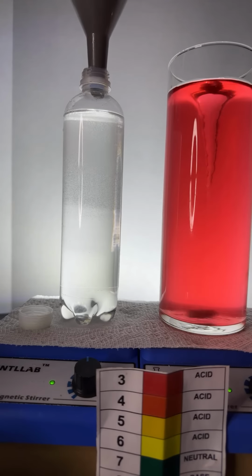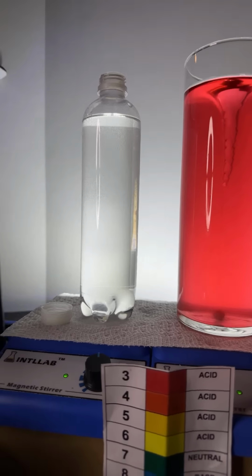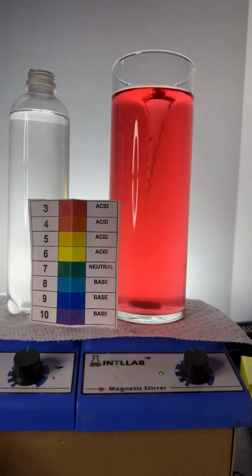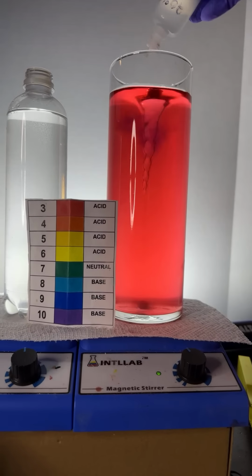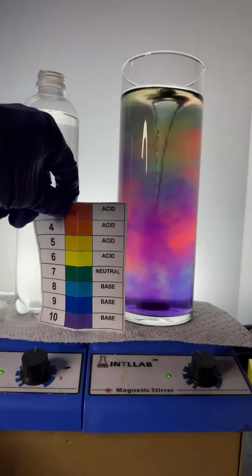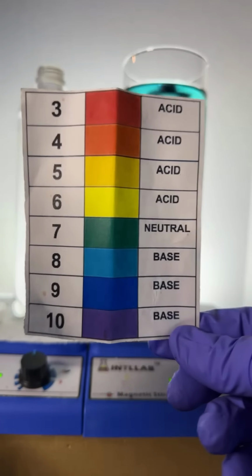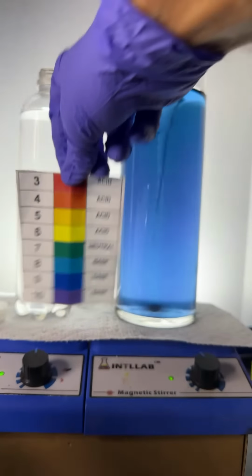Now, let's add the acid-base indicator to this one. What's the acid-base indicator? It's the stuff that I have in this solution over here. So if you see, I'm going to go ahead and add some sodium hydroxide over here. And when I do that, the dye shifts to a more blue color. And that's just your pH scale. When you add base, you're going to go this way on the chart. When you add acid, you're going to go this way on the chart.